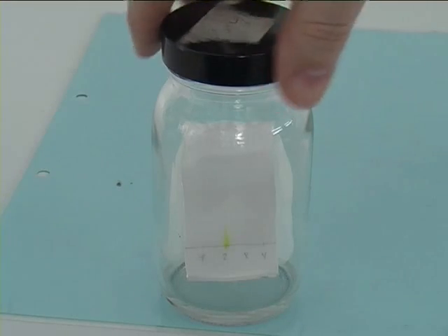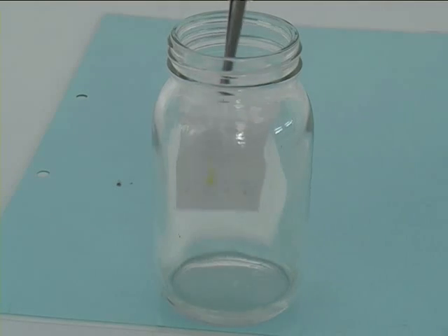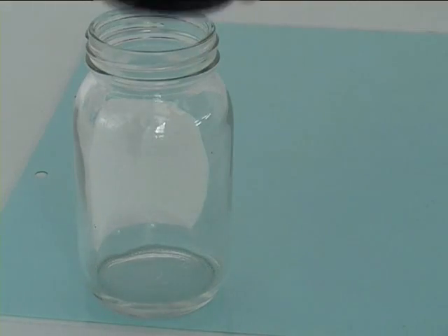After the TLC plate has finished, open the TLC jar, take your pair of tweezers to take the TLC plate out, and immediately mark with your soft pencil the front line of your solvent.